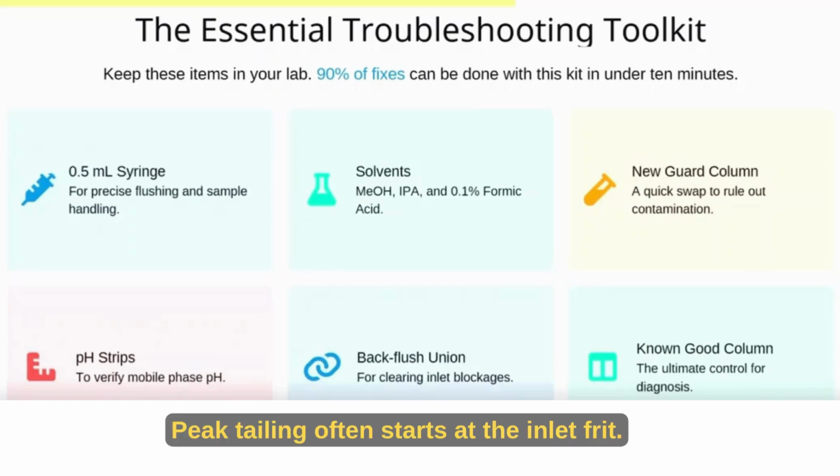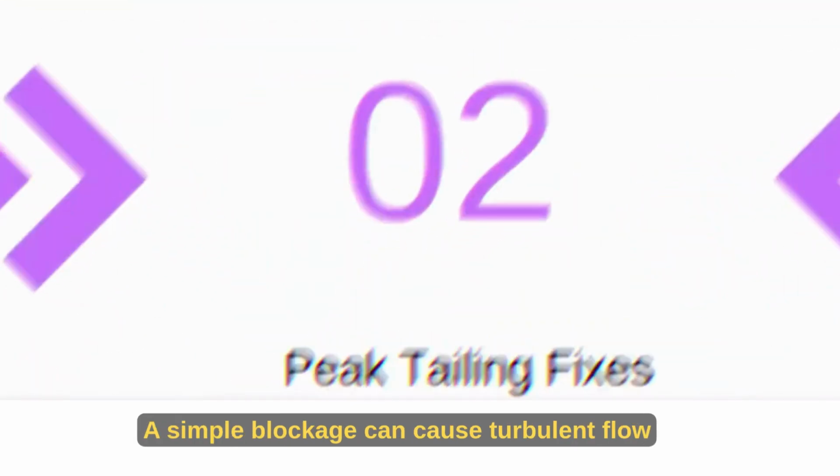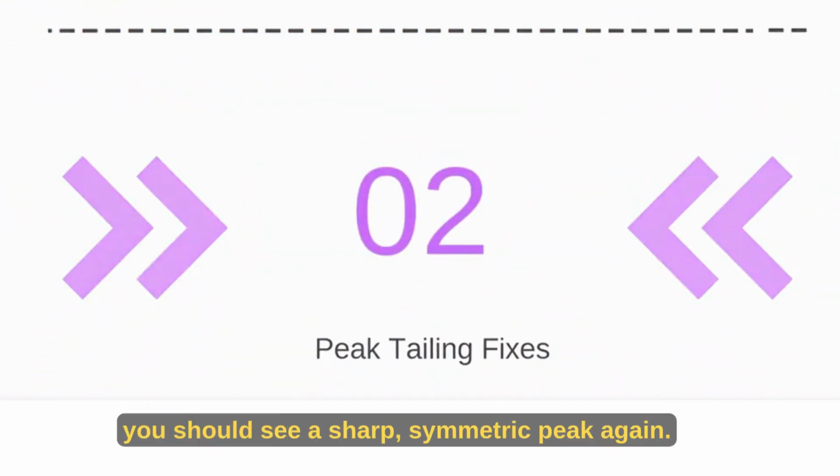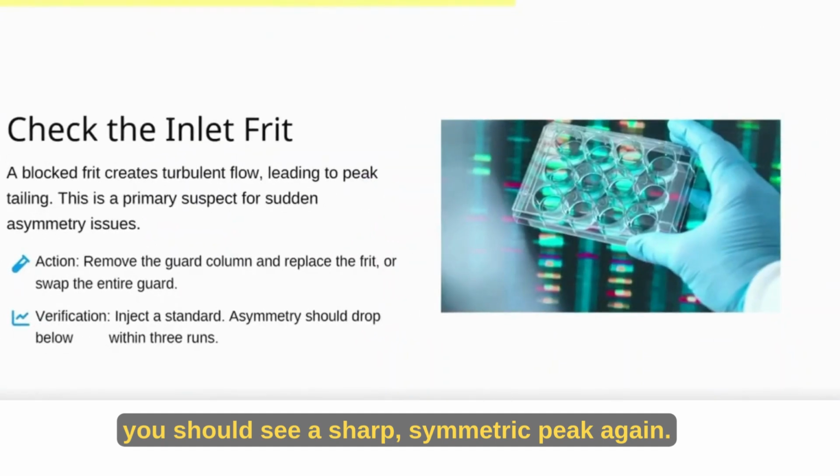Check the inlet frit. Peak tailing often starts at the inlet frit. A simple blockage can cause turbulent flow and ugly asymmetry. Replace or clean the frit. After just a few runs, you should see a sharp, symmetric peak again.